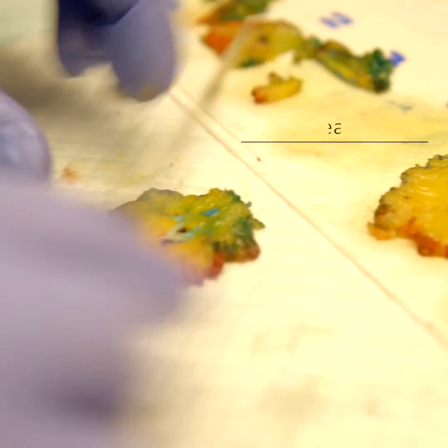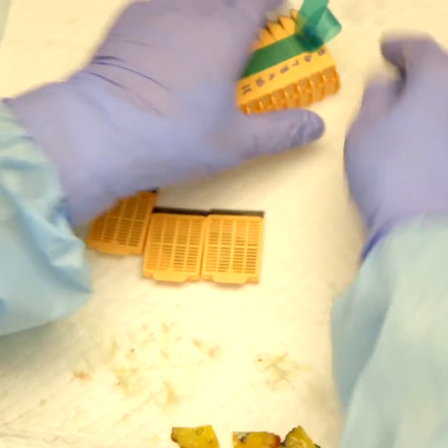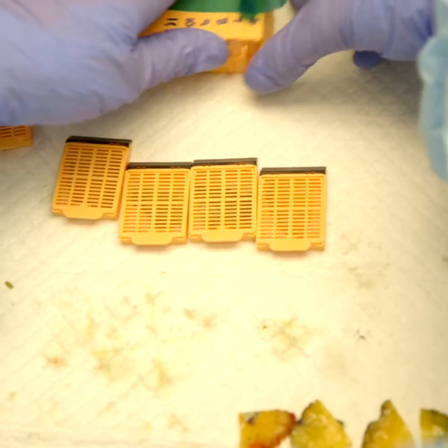After I finish my dissection of the tumor, I'm also doing a complete lymph node dissection. My job is to go through all of the fat, and I'll be looking with my hands — palpating out lymph nodes. Lymph nodes are slightly firmer than the surrounding adipose tissue. I'll also be using my eyes to look for those lymph nodes and submit them in cassettes to later be made into slides for our pathologist to view.